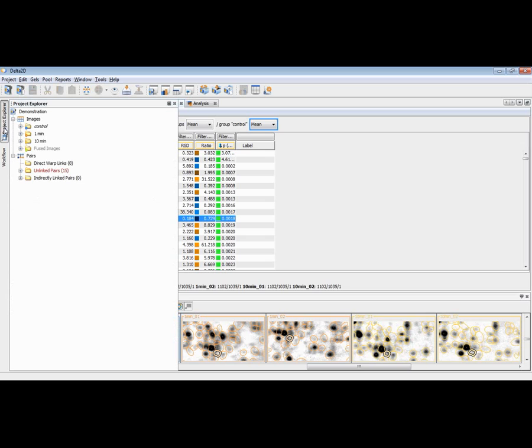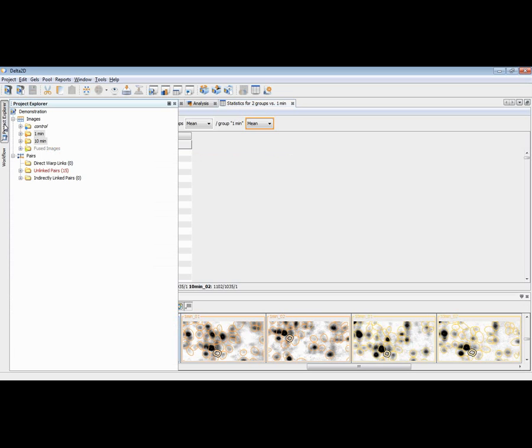You can now open the Project Explorer and then click on the 1 minute group and then press the Control key while clicking the 10 minutes group, and then pressing the quantitation table symbol will open a statistics table for these two groups. The first group that I have selected is the reference group, and the second is then showing ratio and p-value with respect to this first group. And if you have multiple groups, maybe 10 or 20 groups, you can select as many groups as you like, and they will show up in this table in the order that you have selected them.